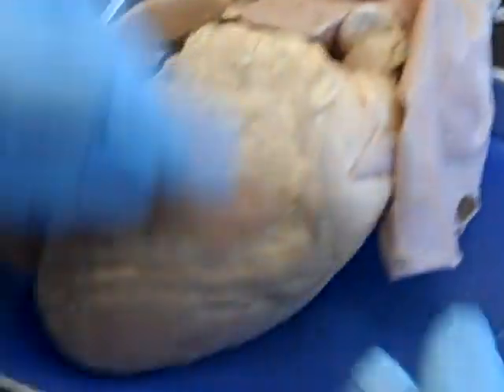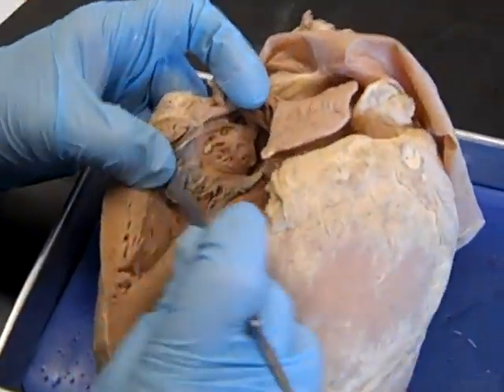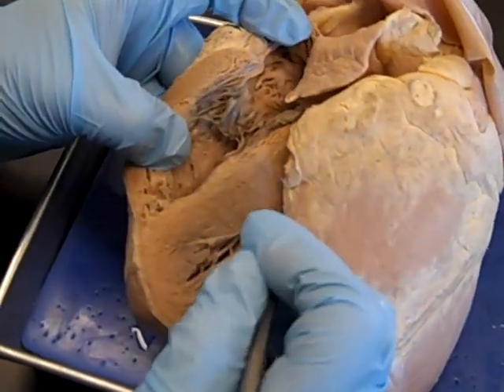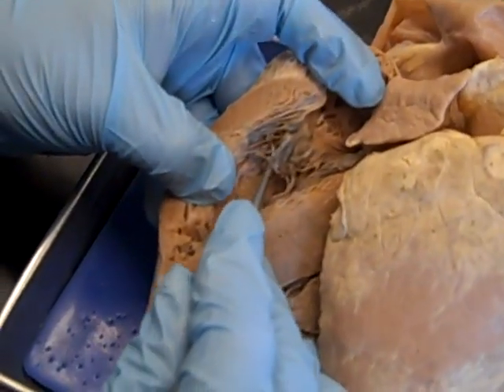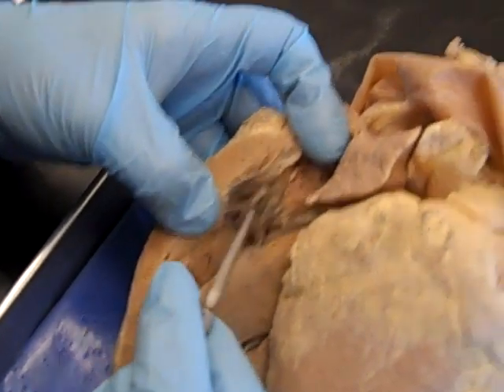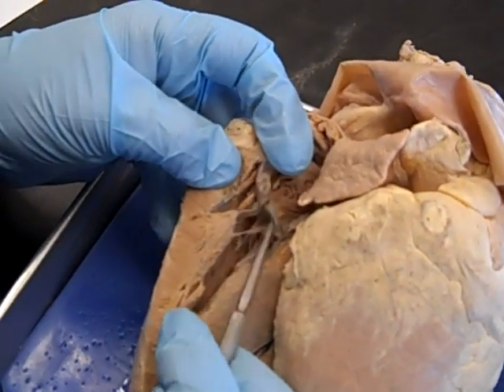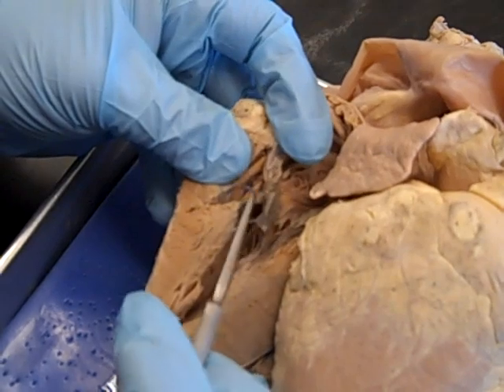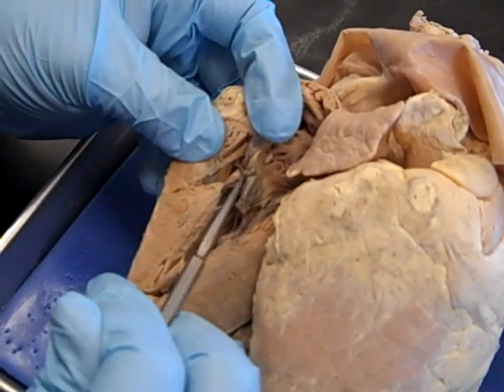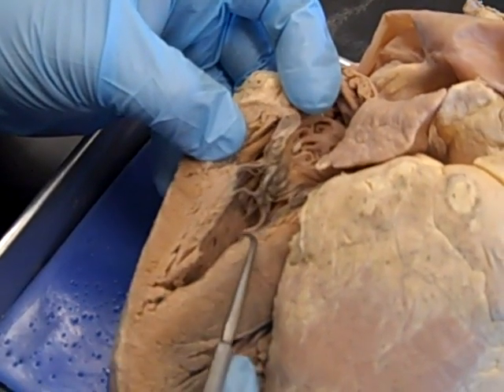We'll go back to this heart and follow the blood. It's gone from the right atrium into the right ventricle. I already pointed out the chordae tendinae and the papillary muscles. If we lift this valve back, you can see some tree-root-like structures in here — these are the trabeculae carneae. Trabeculae carneae means 'meaty beams.' They look similar to the pectinate muscles, except they're found in the ventricles.